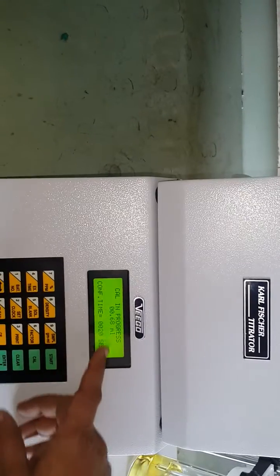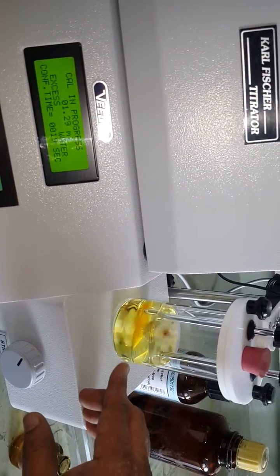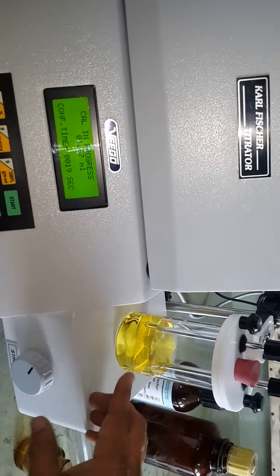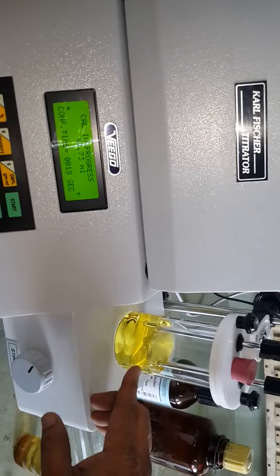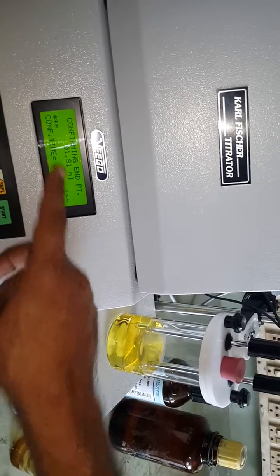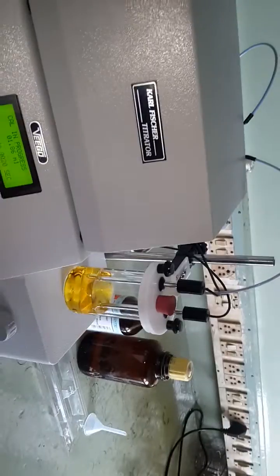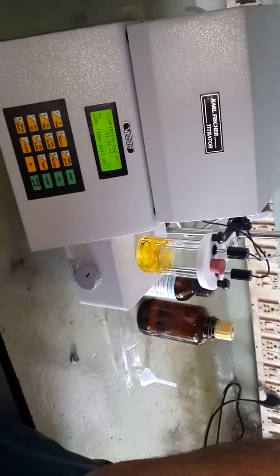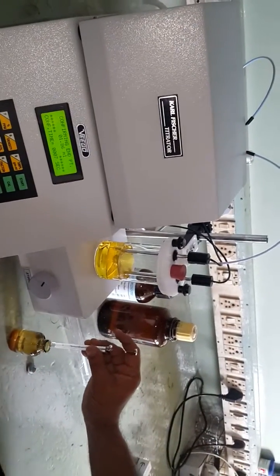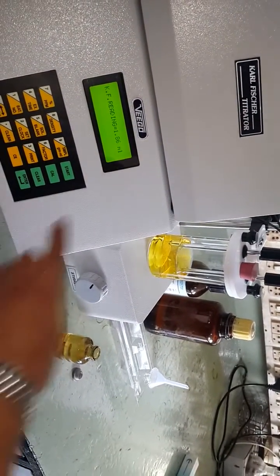When you press enter, the message 'calibration in progress' is displayed. It shows the volume of reagent being added to neutralize the 10 mg of water added. As the reagent is added, the reading is corrected. When excess water is present it adds reagent; when there is no water, the excess water signal goes off and confirmation time counts from 20 seconds towards zero. Keep the next 10 microliter sample ready as it approaches the endpoint. The reading is 1.86 ml.